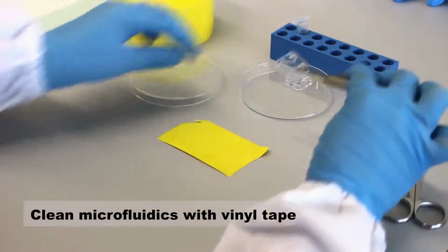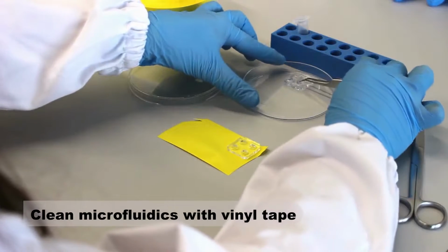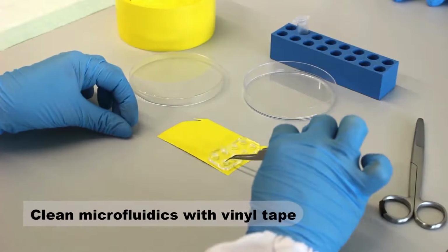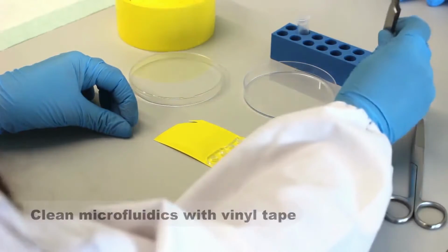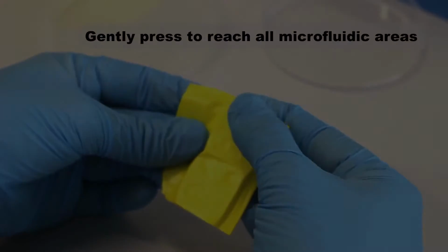On the day before cell seeding, start by preparing the microfluidic devices by cleaning them with vinyl tape. Gently press the tape against the device to reach all areas of the microfluidic.